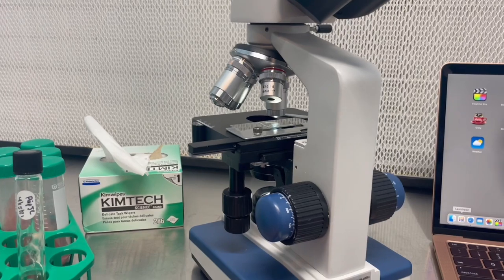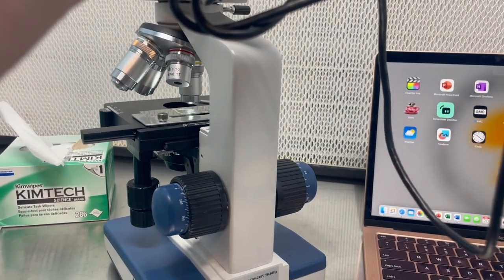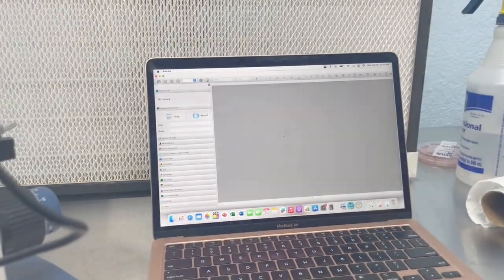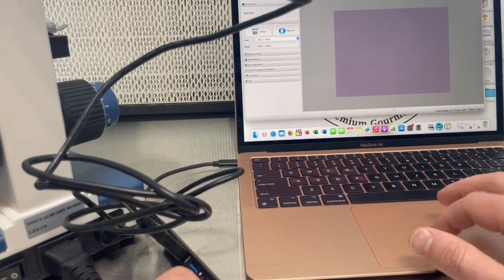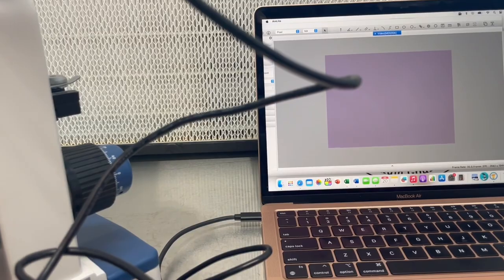Turn on the microscope. And then we're gonna open up our software, once I get this camera hooked up. I had to grab my USB connector, but we're gonna jump into this camera here. And I'll go ahead and start to focus in. So I've got this region here in focus, and I'm gonna record it on the computer so we can see a little better what's going on.